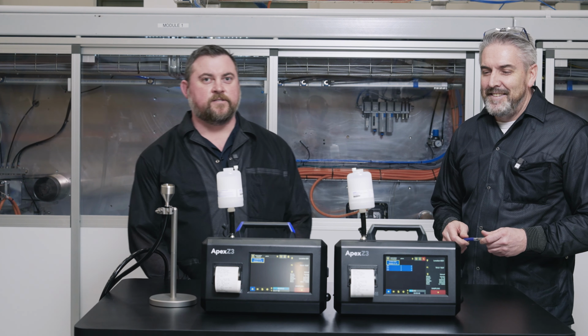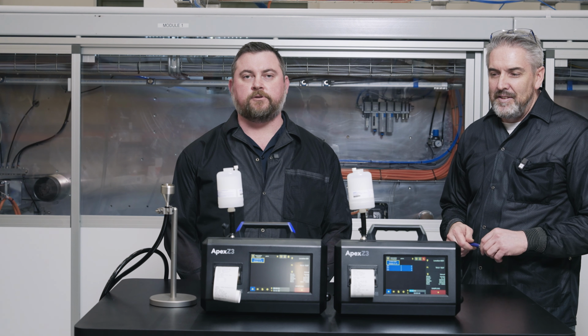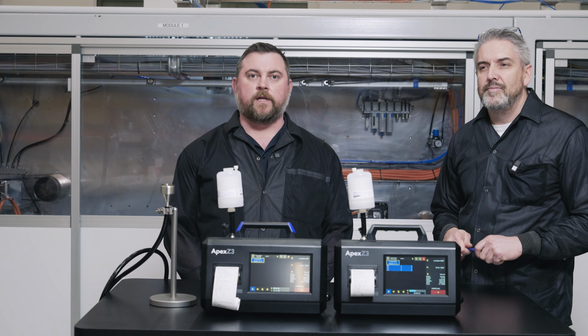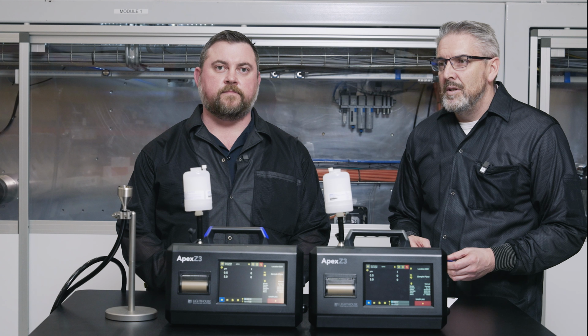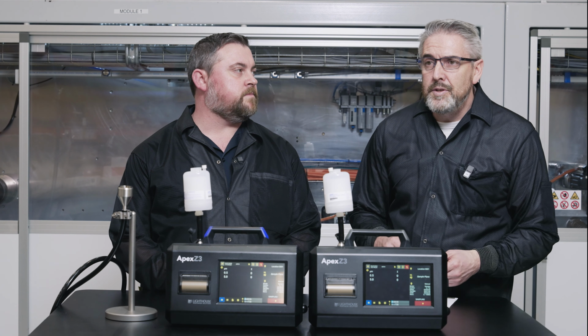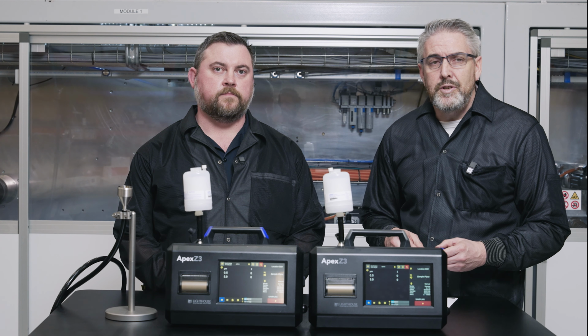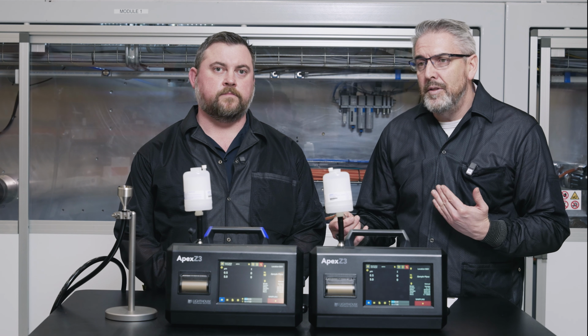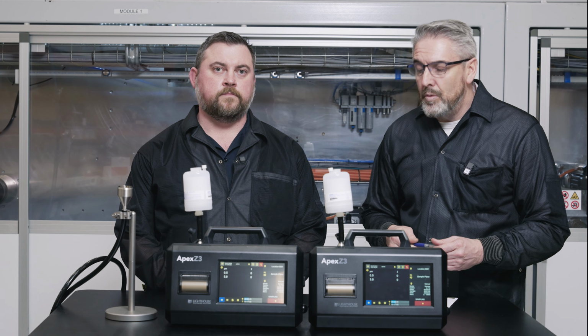Thanks, Jason. So yeah, I've been here at Lighthouse Worldwide Solutions for a couple of years, working in the metrology department, helping develop SOPs for a variety of processes and ensuring the highest quality in our calibrations and the most repeatable results for our instruments. Yeah, we are accredited to 17025, which is a major laboratory calibration accreditation for any laboratory that does calibrations. We're accredited all across our service centers worldwide.